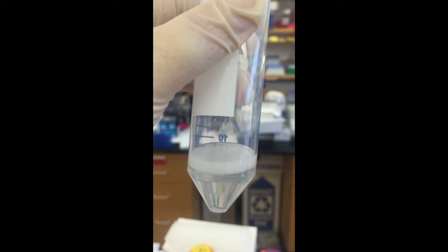So while you're actually running DropSeq through the devices, you want to look at the triangle to make sure that it's not pulsing or flickering. And then, as I've taught you guys, you want to hold the outflow tubing up against the falcon tube that you're collecting into and watch for that steady stream of blurry droplets coming down that appear uniform by eye.